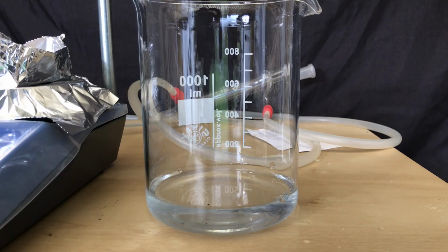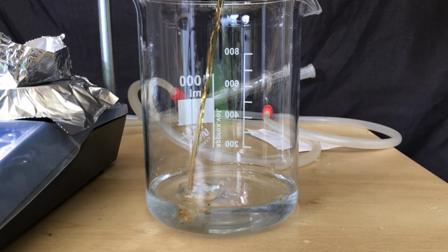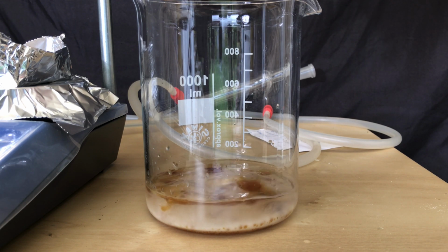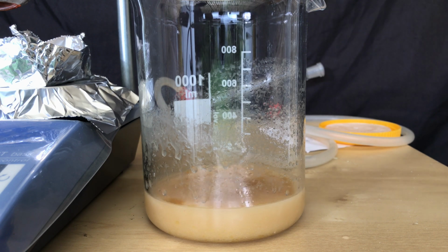However, the substance looked tar-like. The mixture was then put quickly into a beaker containing distilled water, followed by some potassium carbonate, because I hoped that I could get free-based diphenhydramine by doing this. Free-based diphenhydramine should be nearly insoluble in water, while the salts are somewhat soluble.